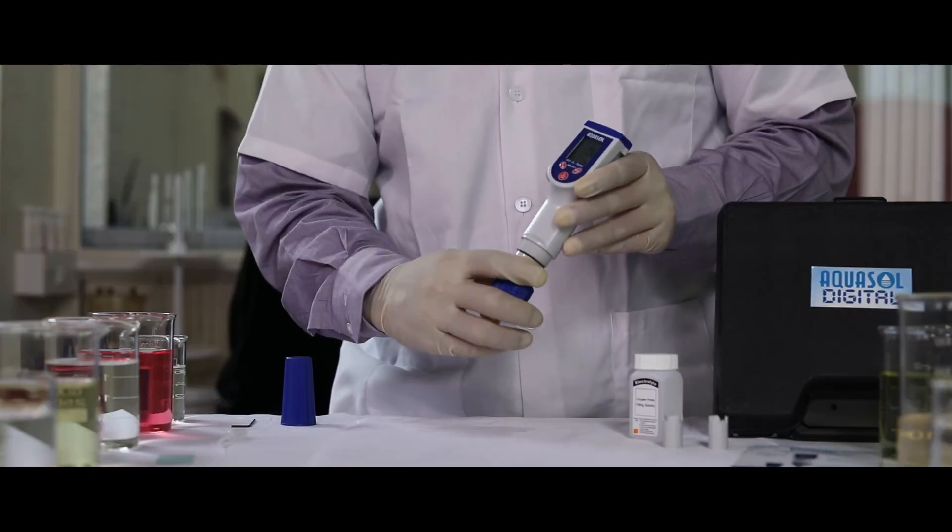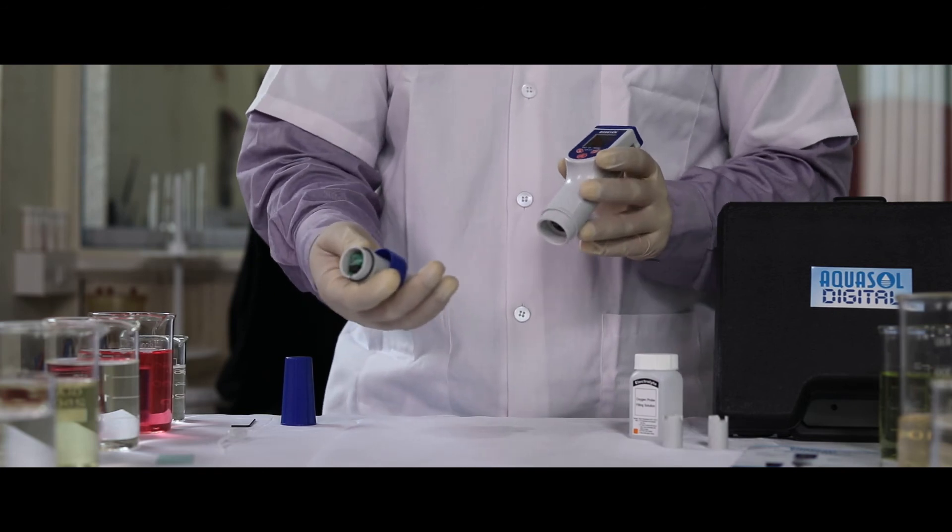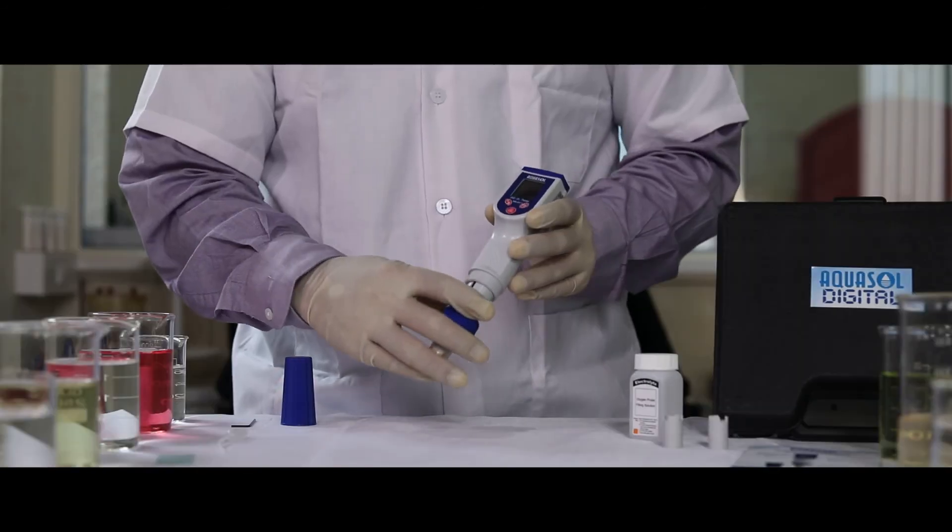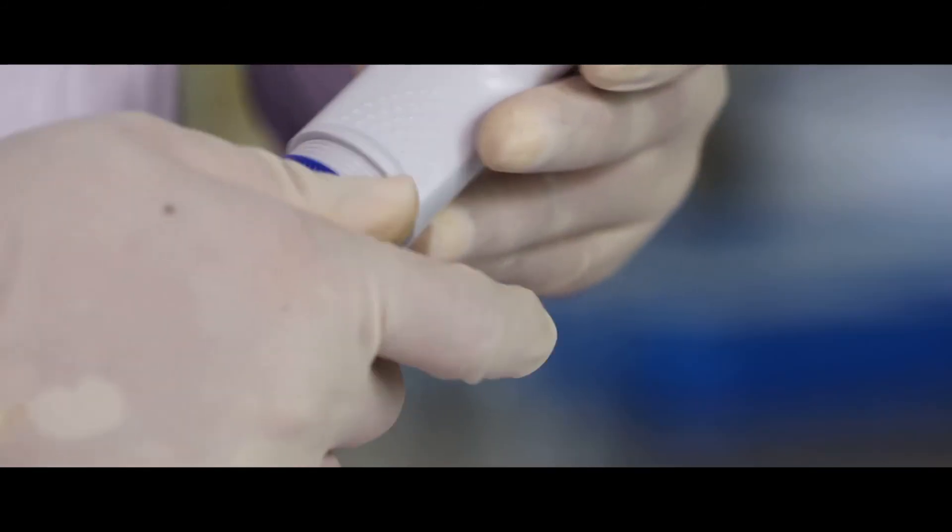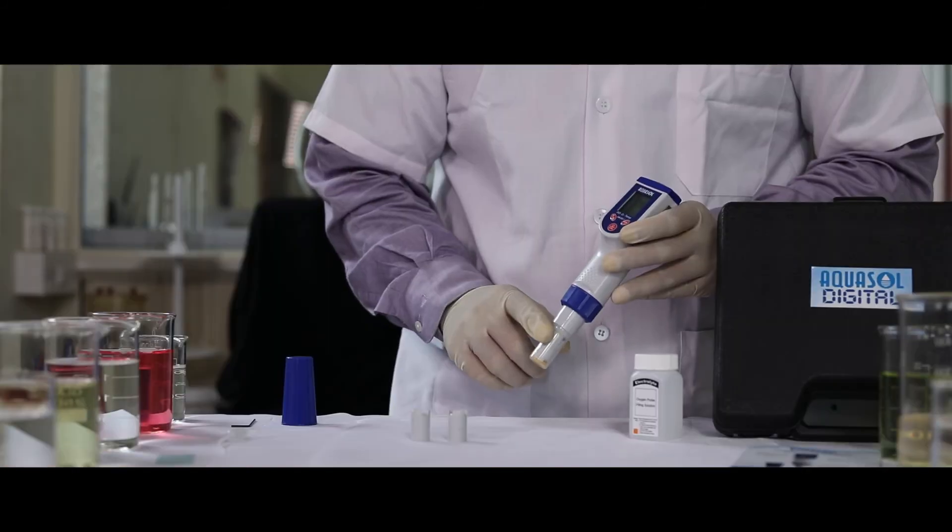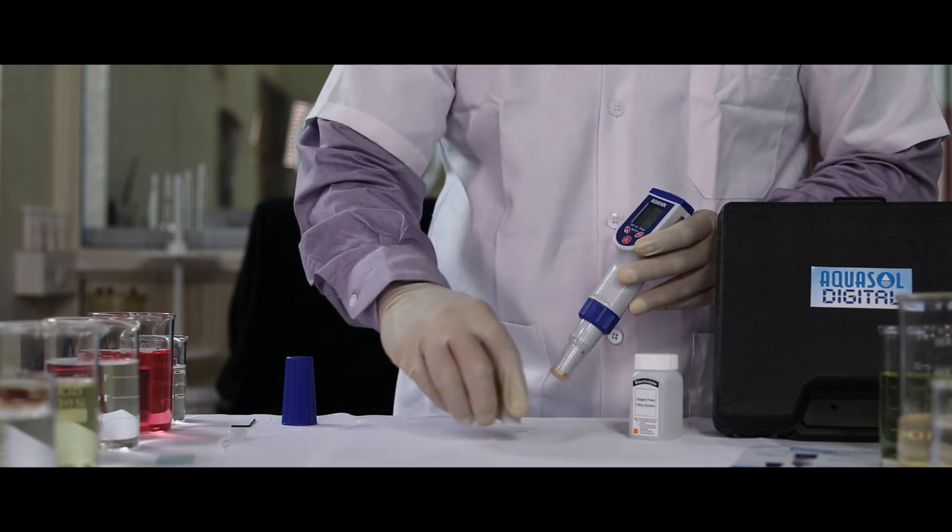To replace the electrode, unscrew the electrode collar and separate the electrode and replace it. We do provide an extra membrane cap along with the meter.